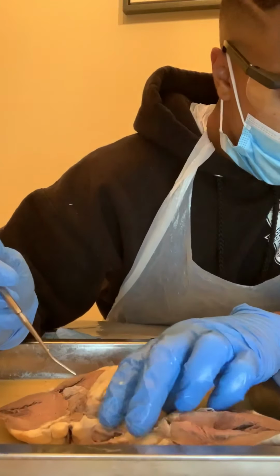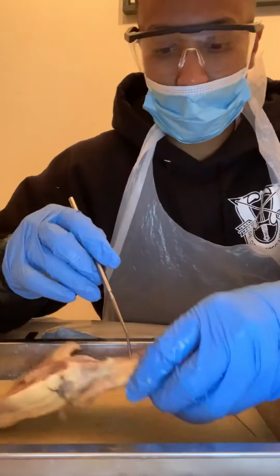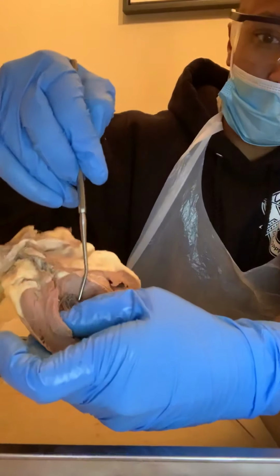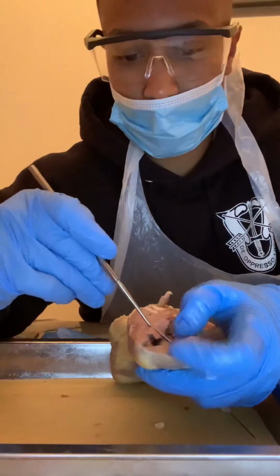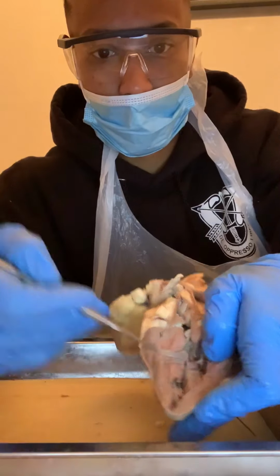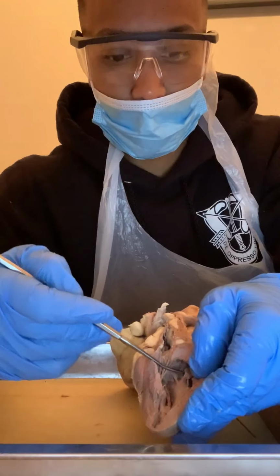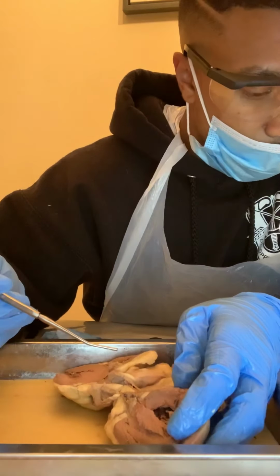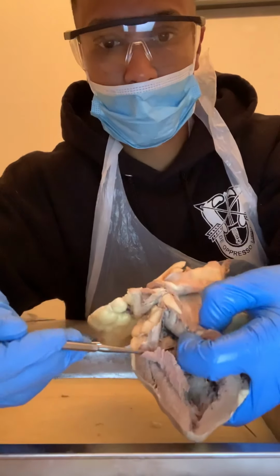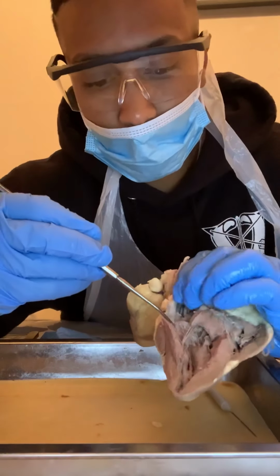And then for the inferior, going to be the bicuspid valve, so that's going to just be right on the other side of it. So the bicuspid valves are on this side. Oh, sorry, my thumb's in the way. So bicuspid valves, let's see if I can open it up. It's going to be on this portion over here because you got your tricuspid on this side. So your bicuspid is on this side right here. And then the aortic semilunar valve, that's right here, the base right here. Let me pull this back so you can see that better.